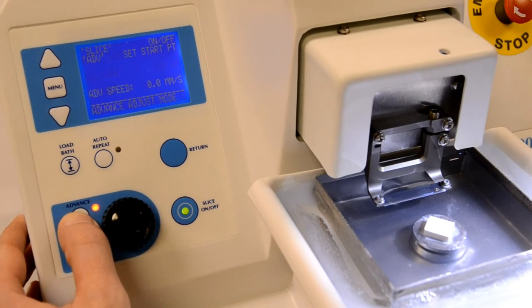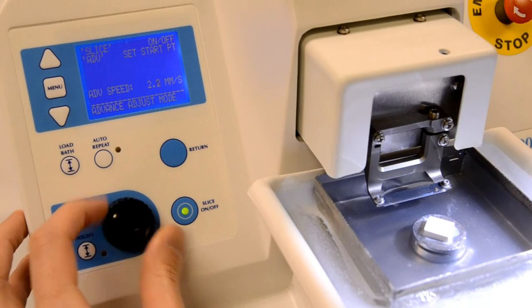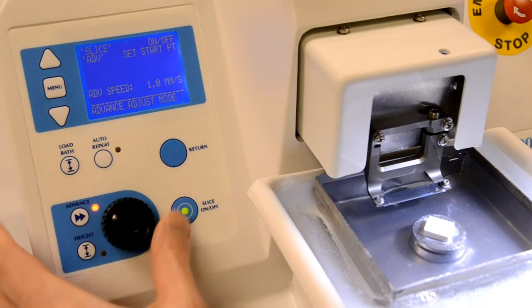We can now set the start position of the cutting head. To do this, press the advance key and then, using the rotary knob and slice on-off key, move the head to a suitable start position.